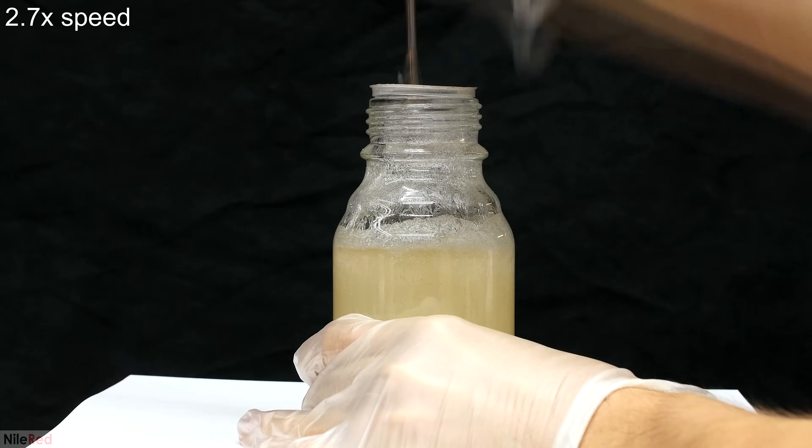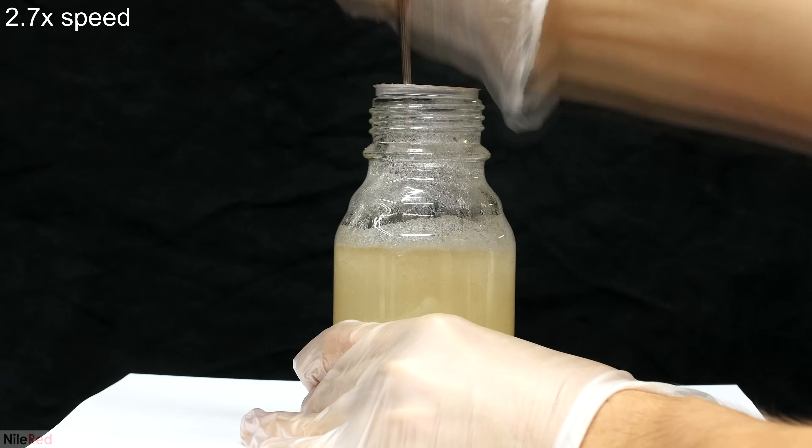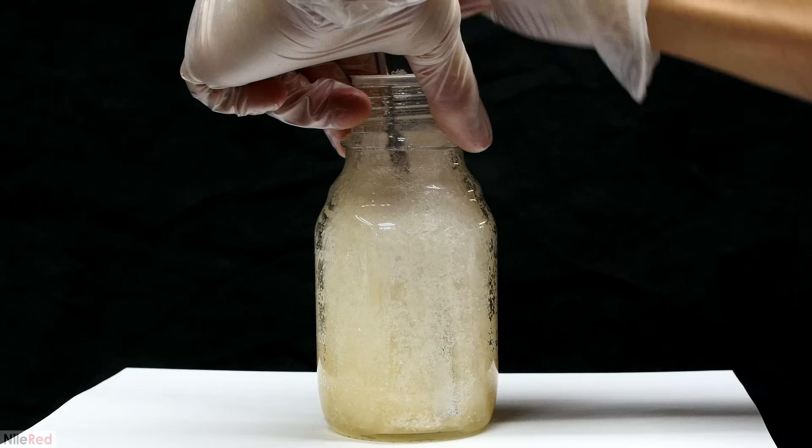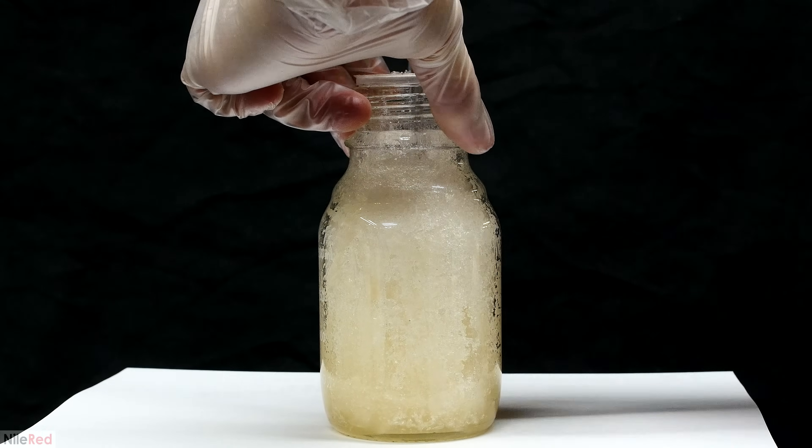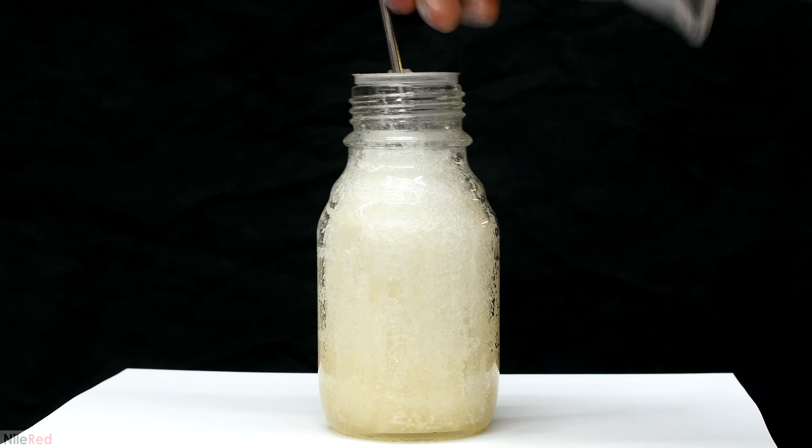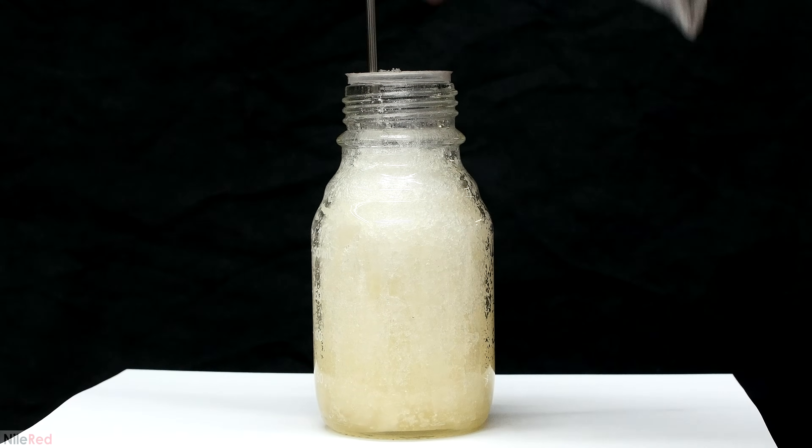Before it completely solidifies, it's a good idea to break things up. This way, once things have completely solidified, we'll be left with a jar of loose phenol, and not a solid chunk.